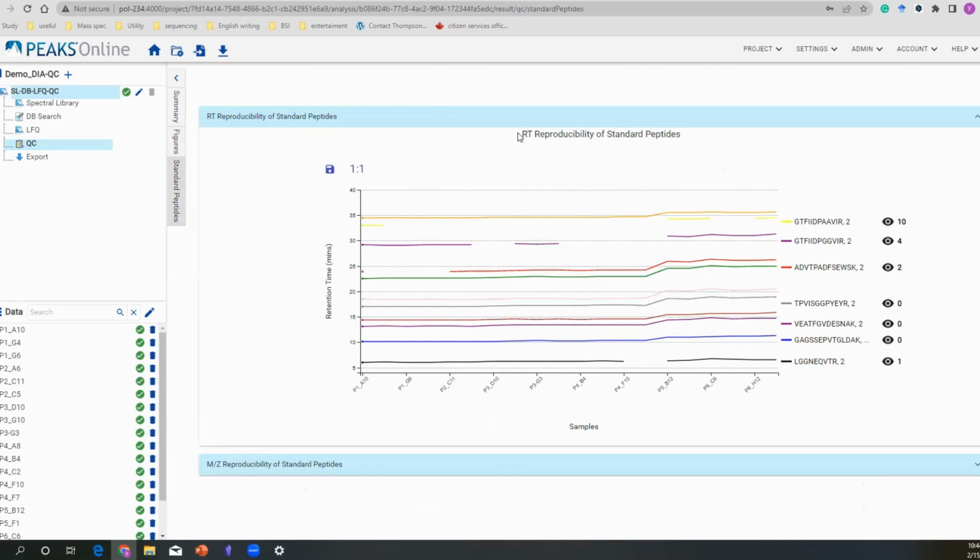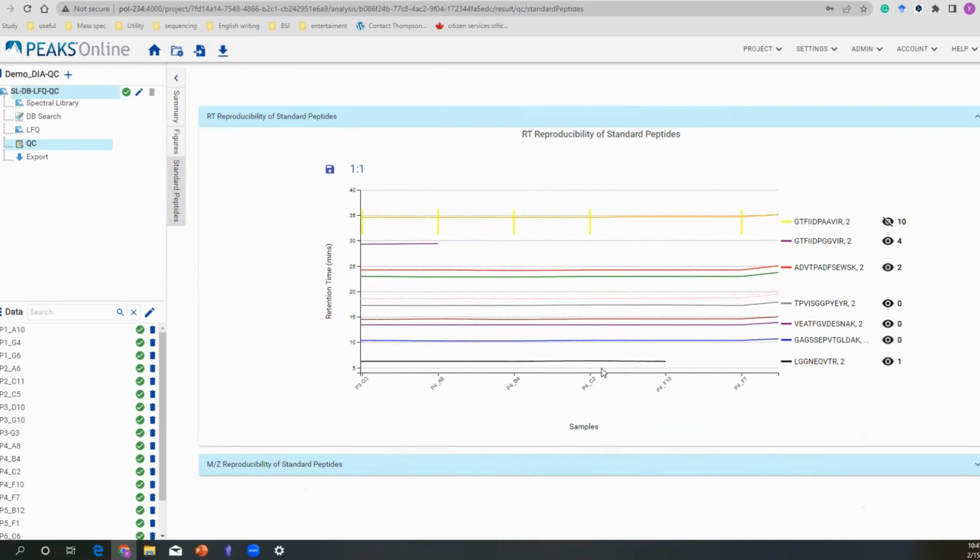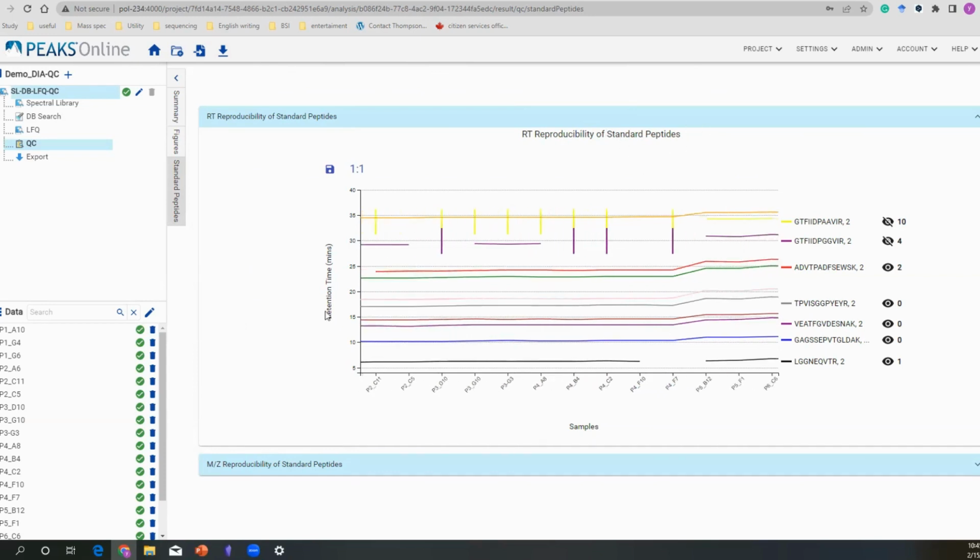The first one you see is a retention reproducibility chart. This number is how many times the peptide is missing. You can click that, and you can see, oh, I missed my peptide in most of my runs. I can zoom in to see which one I am actually missing. For example, this one has also missed the EMP4 in some of my samples. So you have a direct view of how my standard peptides behave.